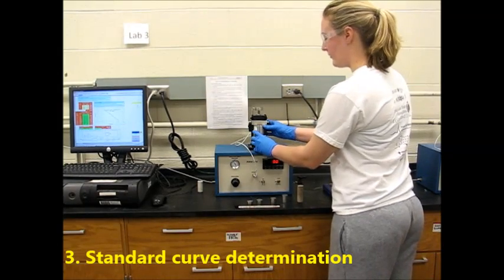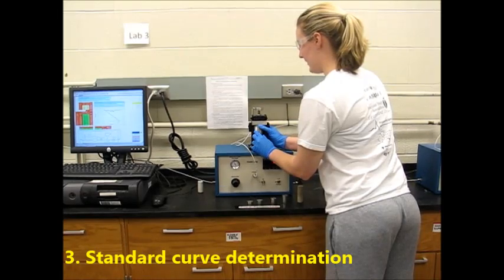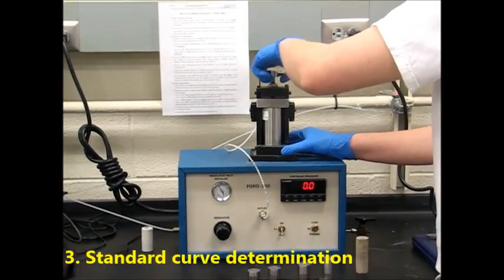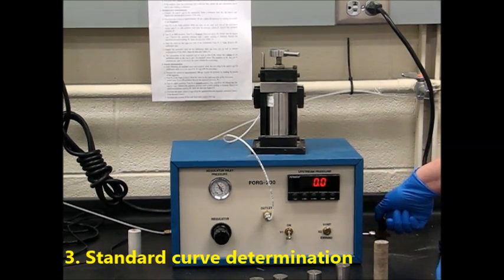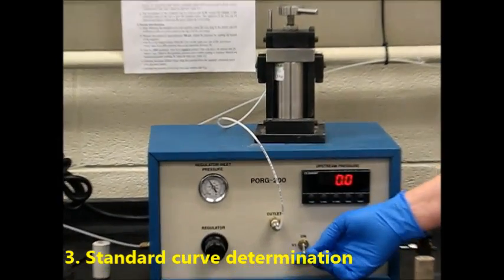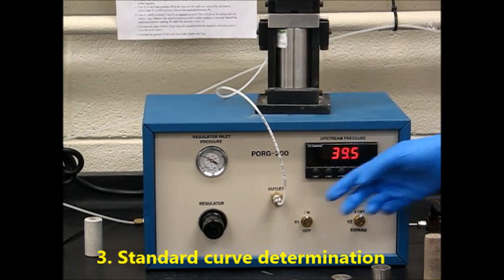We're going to put in disc number 1 and then place it evenly and close the lid. Make sure that your valve on the back side is turned off. And now we're going to turn V2 to the vent position and V1 to the on position. Wait until the pressure is stabilized and then record the upstream pressure. This is P1.